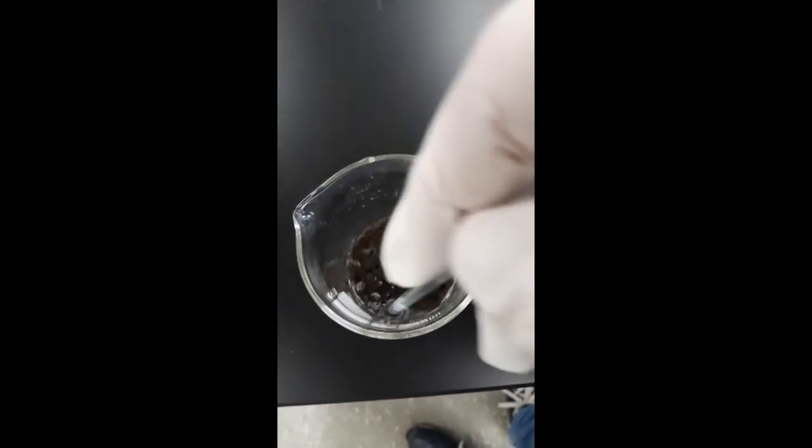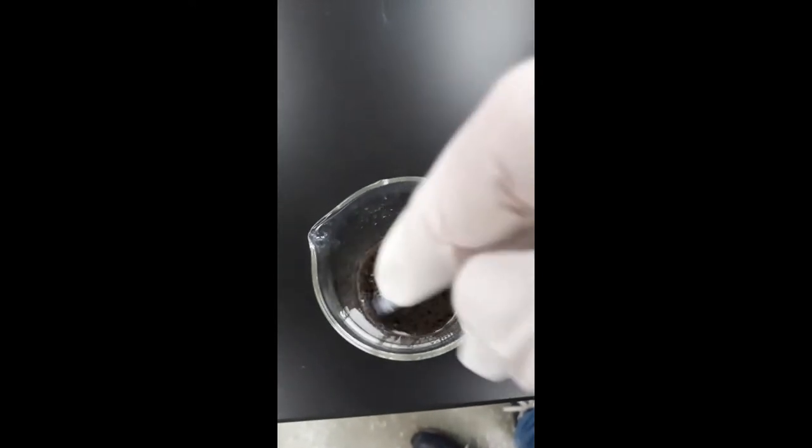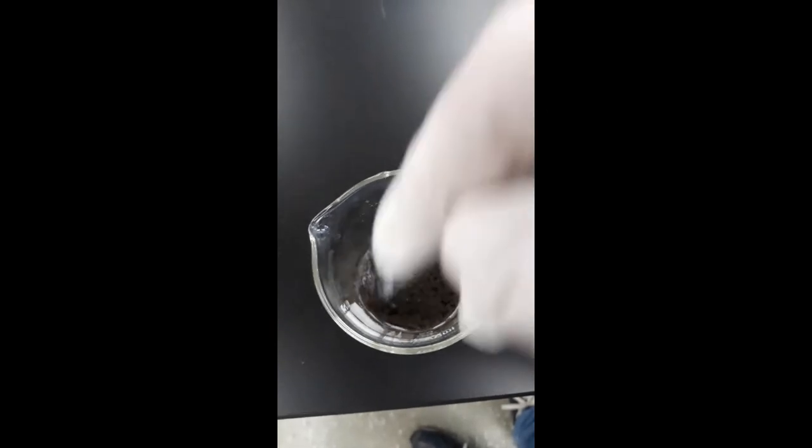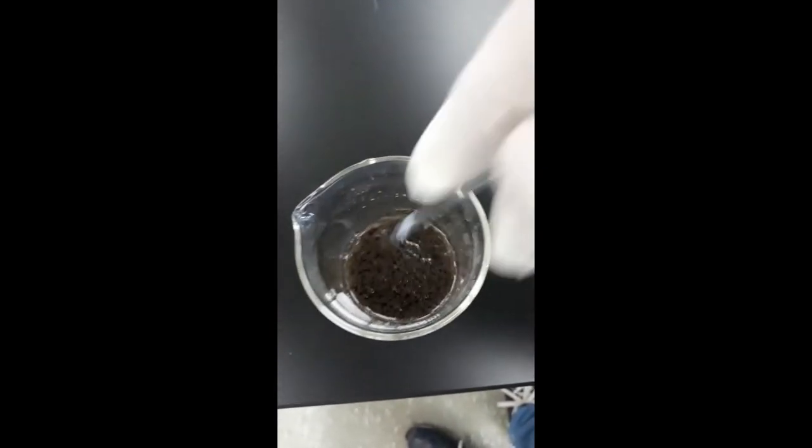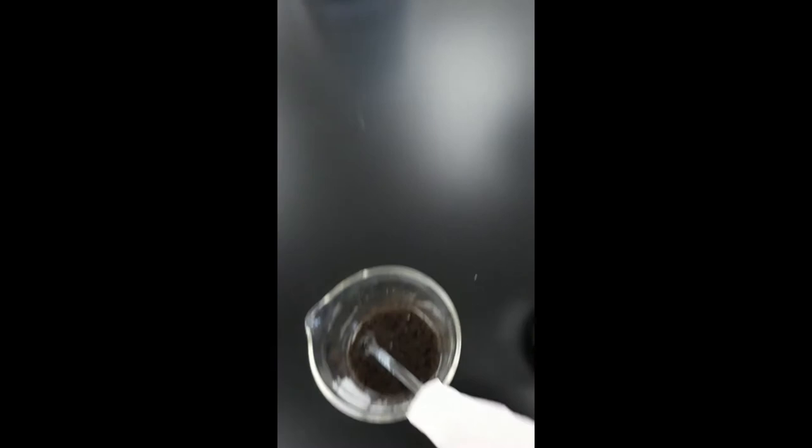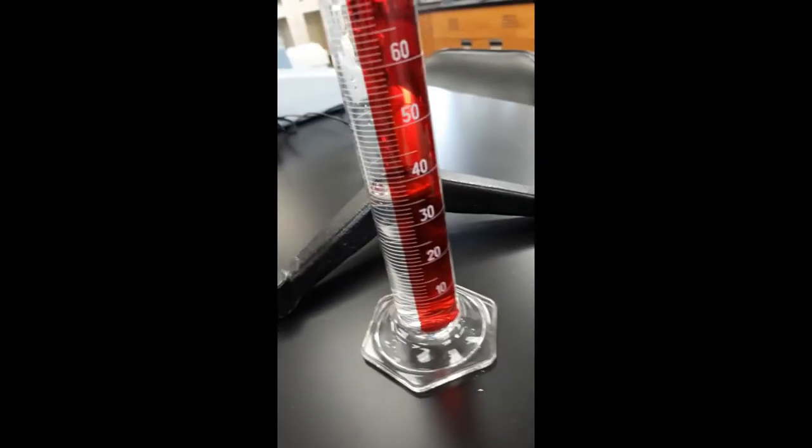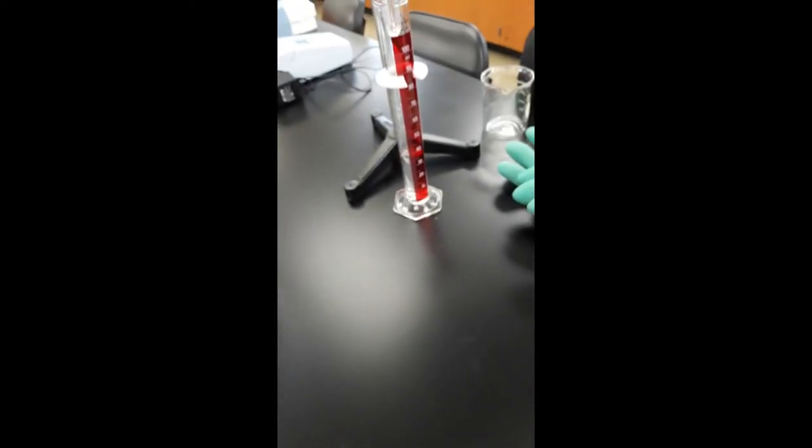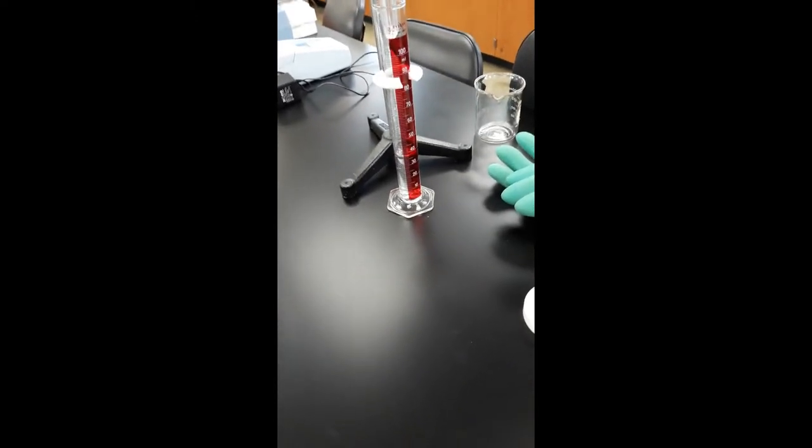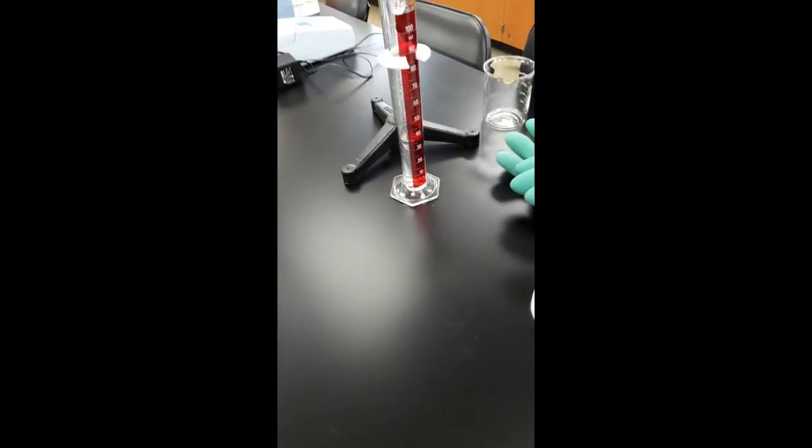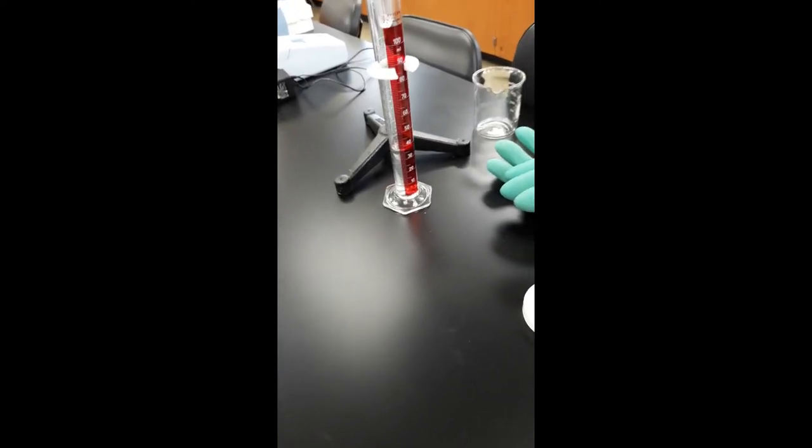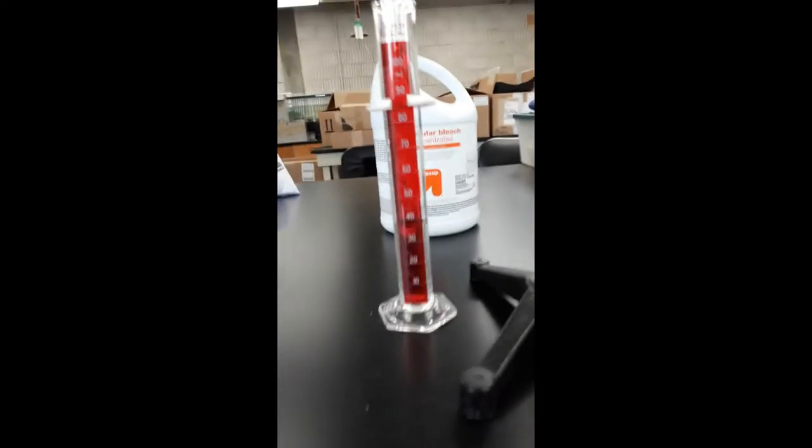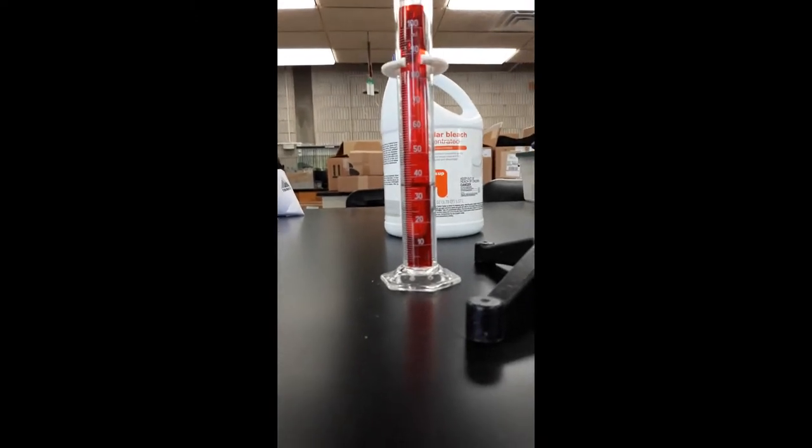Now one of the things why we do this is actually to find what's the best dose so that we're not using a lot of extra. Okay, so we can see over there, let's see how much water has come out.